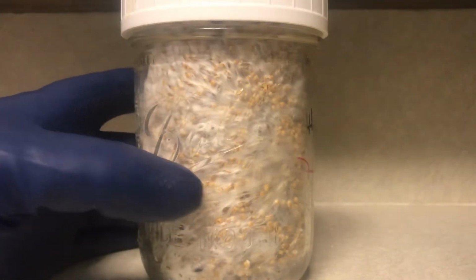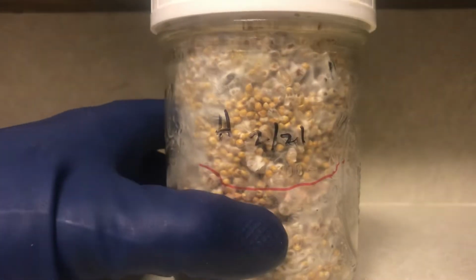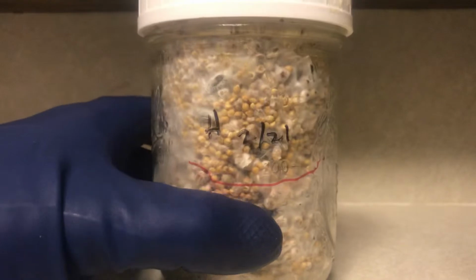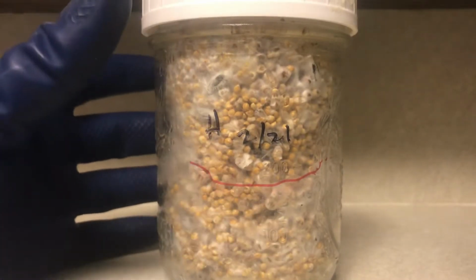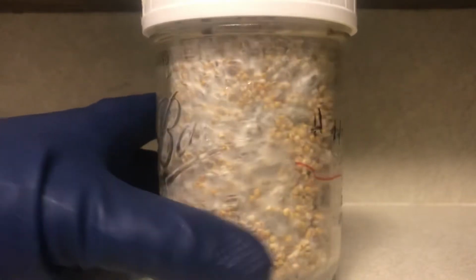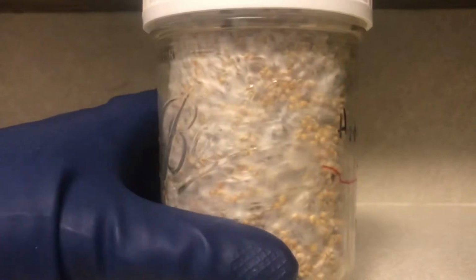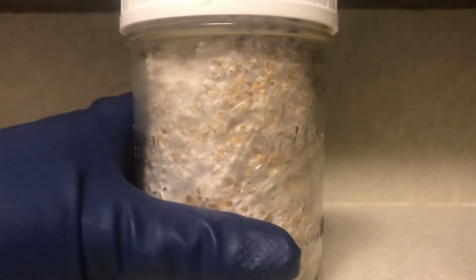Hello, this is a video to show sneaky contamination. So what I have here is a jar of oyster mycelium that's inoculated wild bird seed. And at first glance it looks great. This has been in for about 2 months now, and you can see that the mycelium's all over the whole jar. It's nice and white.